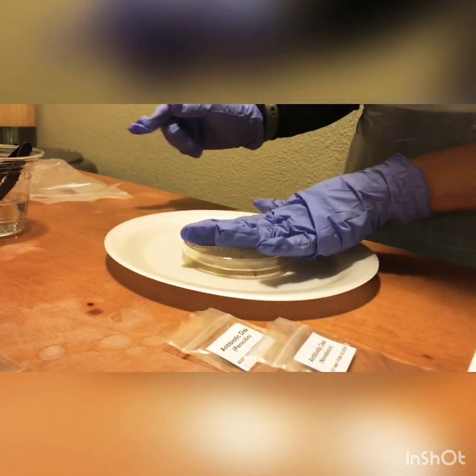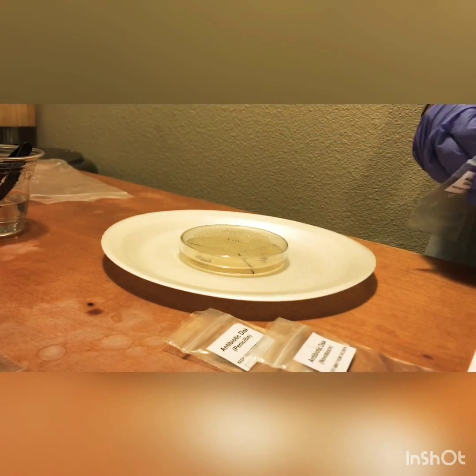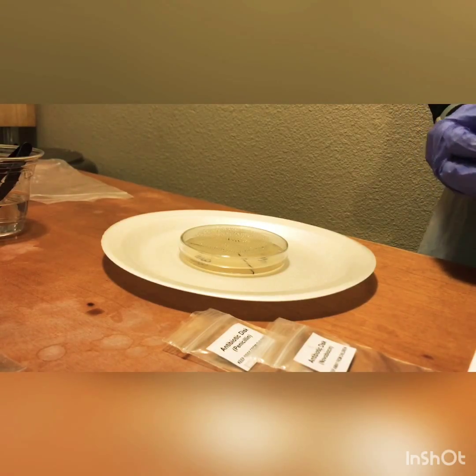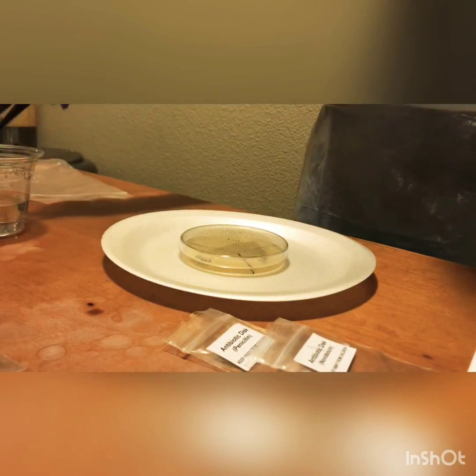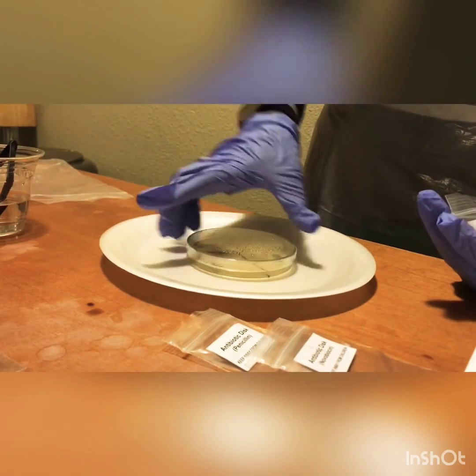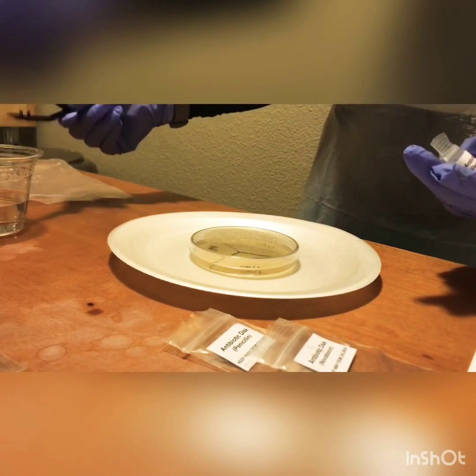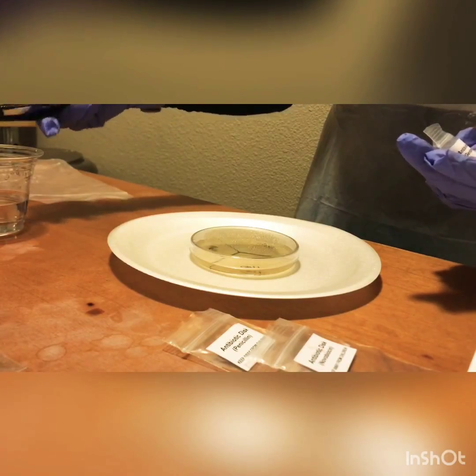We're going to close it again and do this last one. I'd like to get my disc ready to go, and let me turn the last section here, which is the gentamicin. That's the last antibiotic we have. We're going to shake as much of the alcohol as we can off these tweezers.